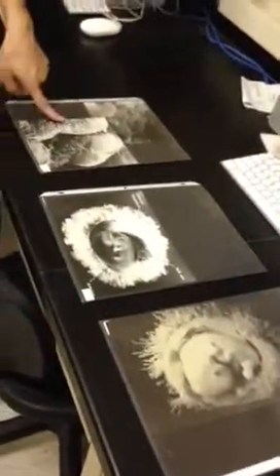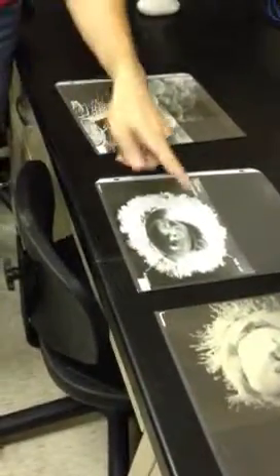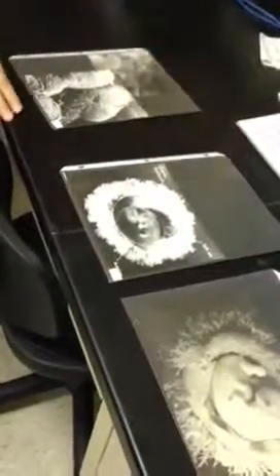I don't even remember what that was when we started review session on. These got these little foot extensions, right? The podocytes in the kidney, at the renal corpuscle, good. And then these guys are the babies. Good. Oh, they have stuff labeled here.